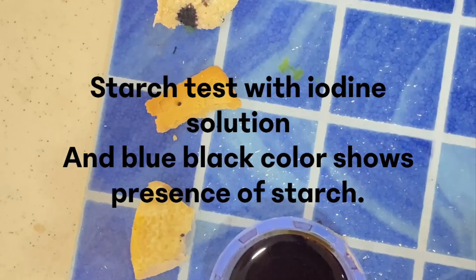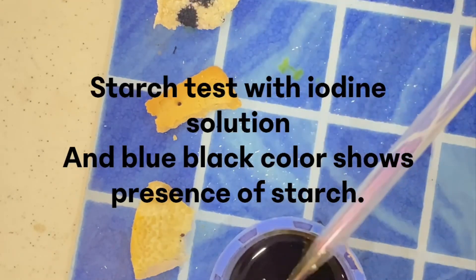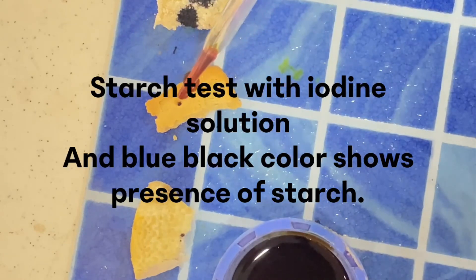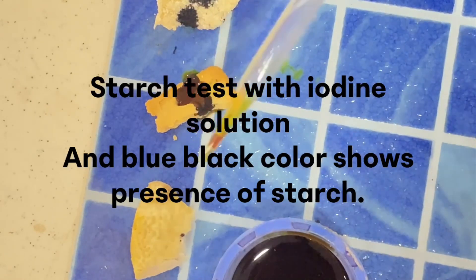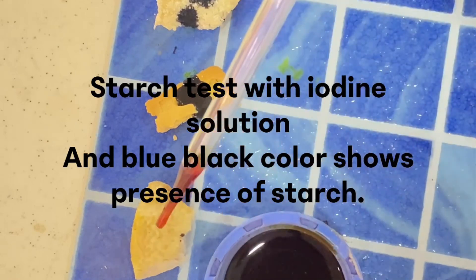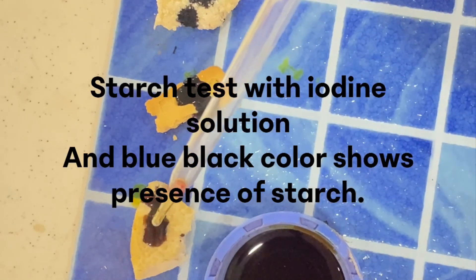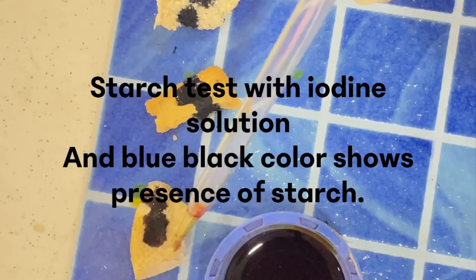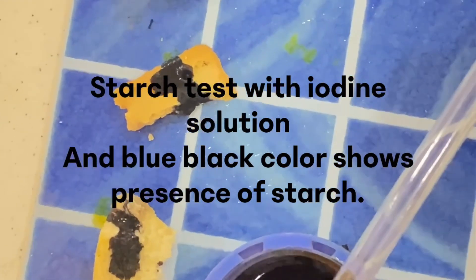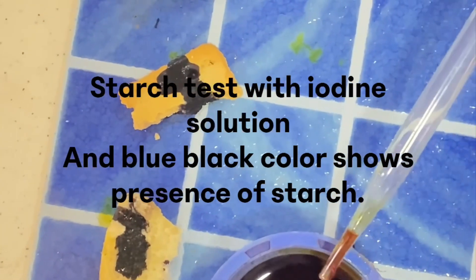Let us also go with the gari — the gari also shows the same blue-black. Now let us go with the biscuits — the biscuits also went blue-black. Let us go with the yam — the yam also tested blue-black. This is an indication that all the food I tested with iodine has starch.